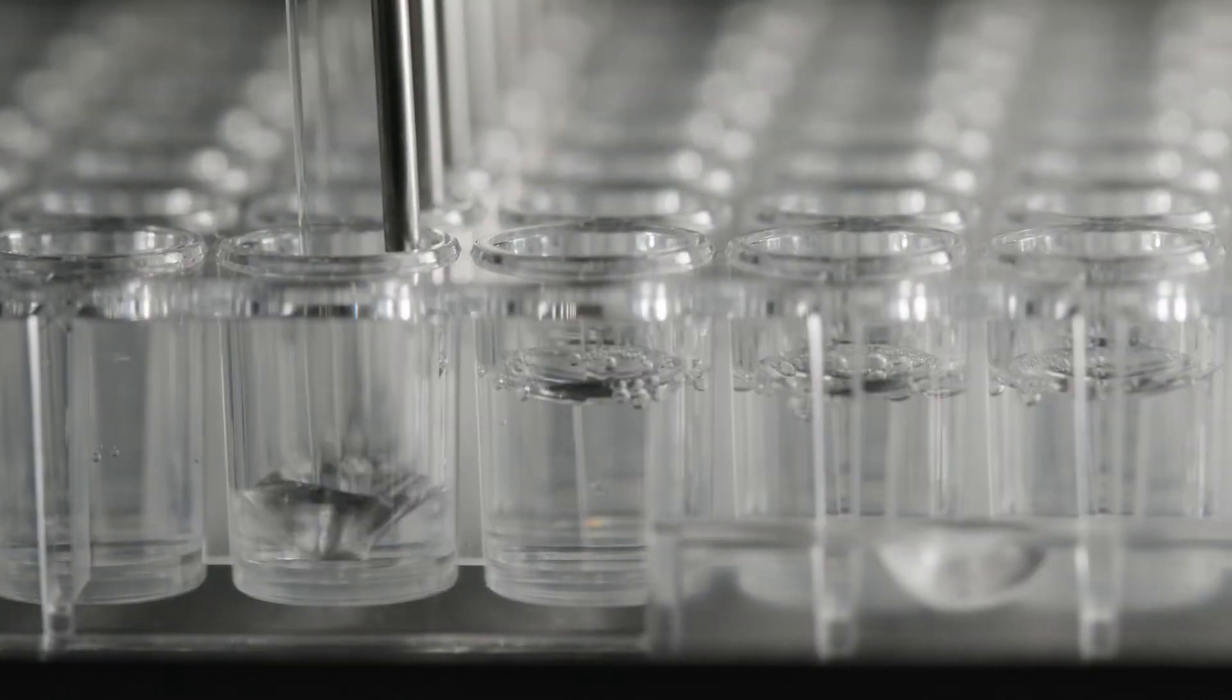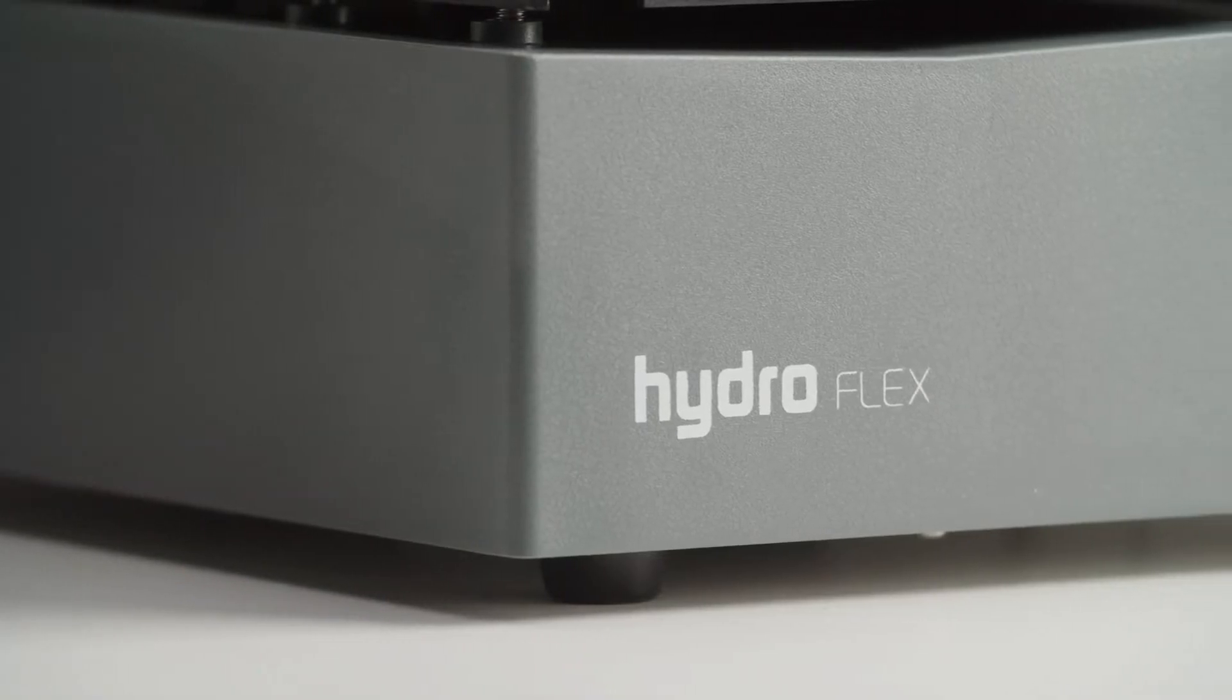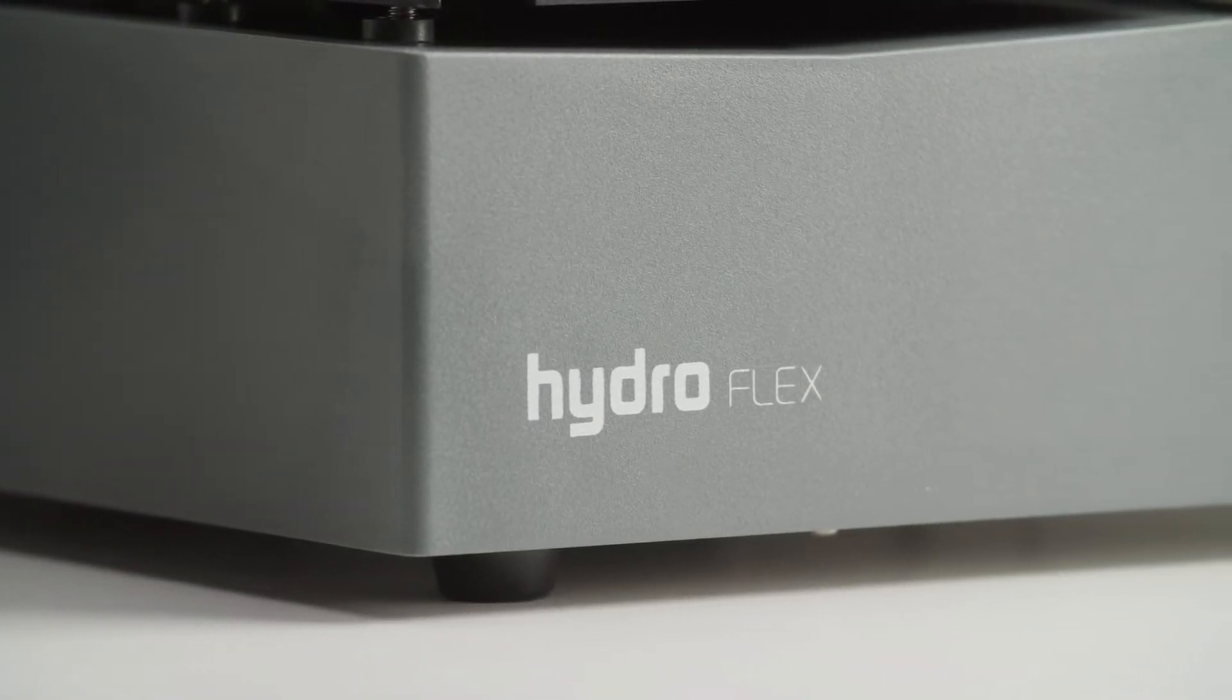Plate offsets are the needle positions for the aspirate, dispense, and wash steps. Optimization is essential for successful performance of the instrument.